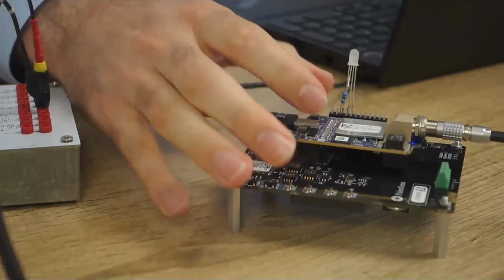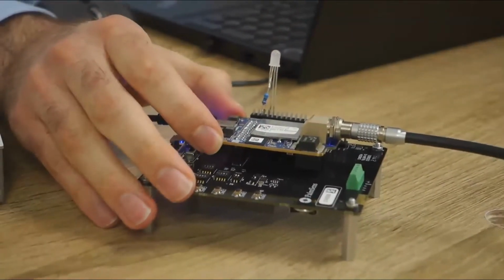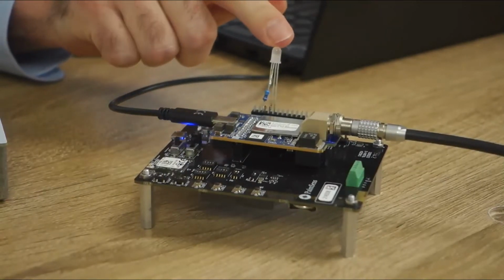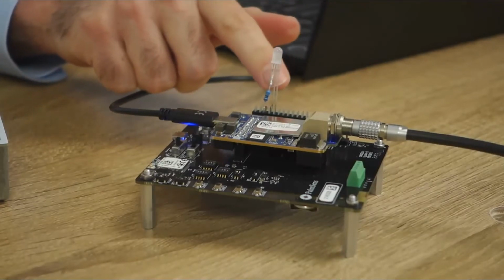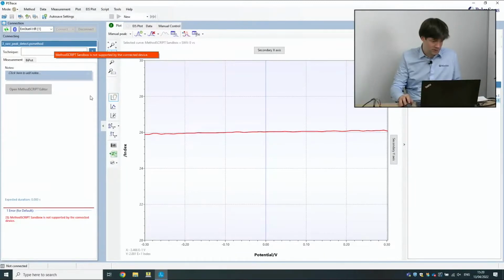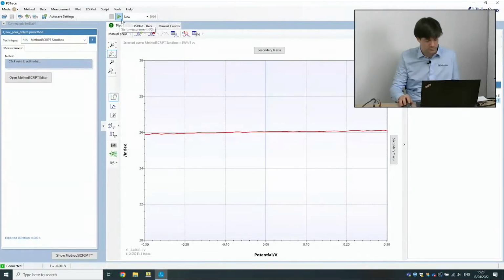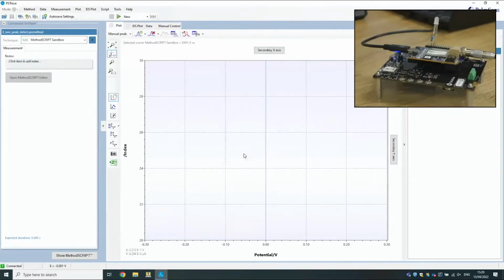So here you see the development board with just a normal EmStat on it. You can take this off if you want. It's just a normal EmStat4 module. What we've done is on the breakout board, we've connected a multicolor LED. So by turning on the pins, as we've seen in the script, we can turn on this LED to different colors. All right, so let's run the script that we had. You still have the test circuit that you previously had connected. It's again the same test circuit. Yes. We're going to start a new measurement, just override the old one.